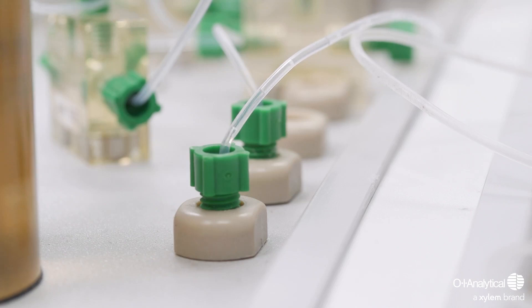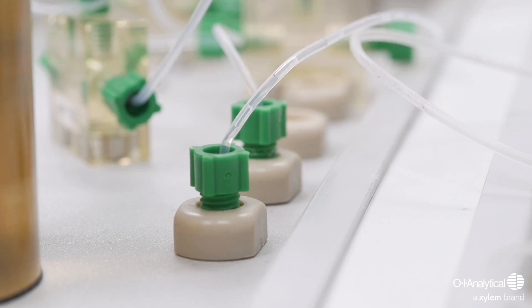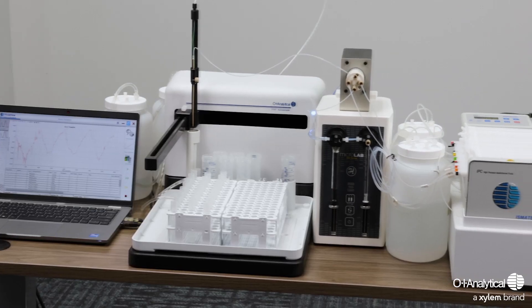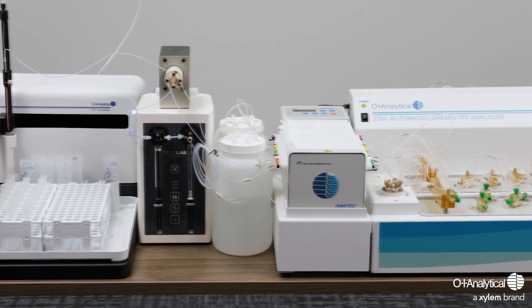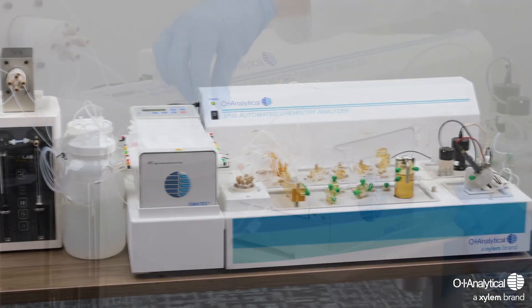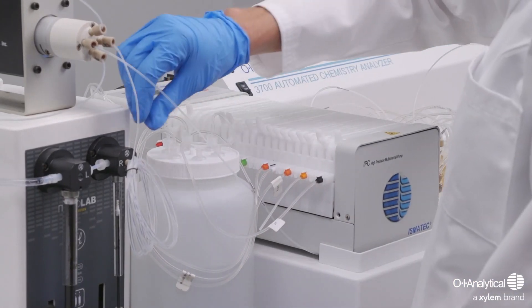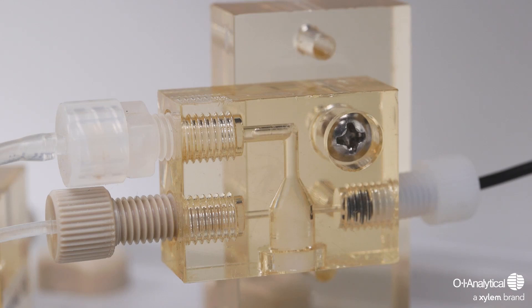With our ACA, you can determine various cyanide levels, including total, available, and post-distillation. With the ability to operate both segmented flow and flow injection chemistries simultaneously, and with an optional autodiluter and UV gas digestion module, we stand as the best option for automated cyanide analysis.